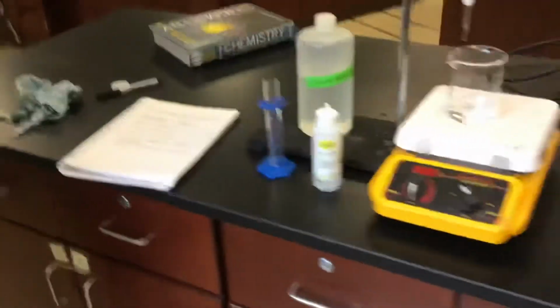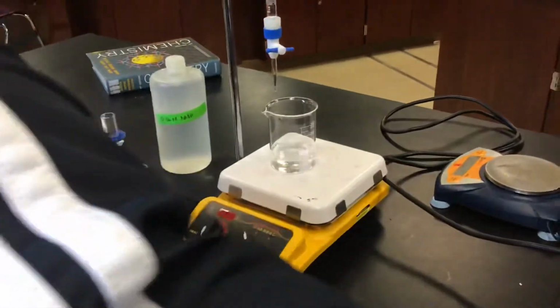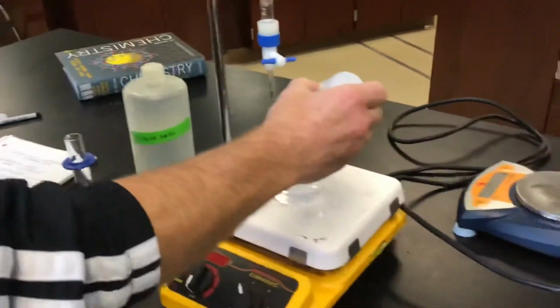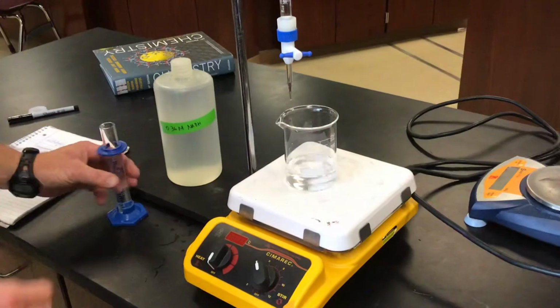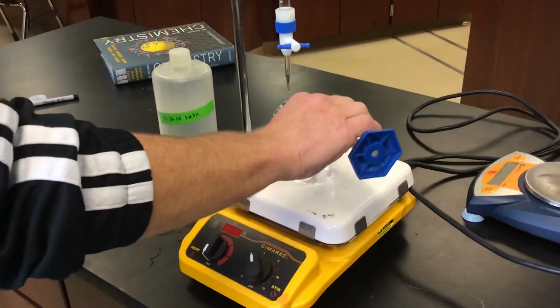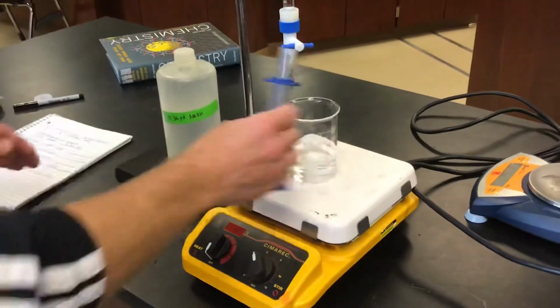All right. So for the setup, first of all, I just have some distilled water in here because once you add distilled water to an acid, of course, you're not going to change the number of moles of acid that are in there. I'm going to add some phenolphthalein indicator to this. So I'll just add a few drops of that. Phenolphthalein turns pink in the presence of a base. Of course, we have an acid in there, and you can make an observation right now. This is my carefully measured out 28.5 milliliters of acid that I want to titrate. And I get every drop of that in there.